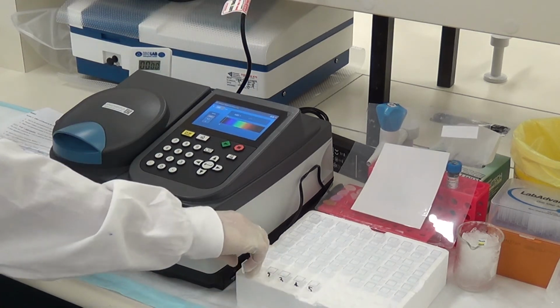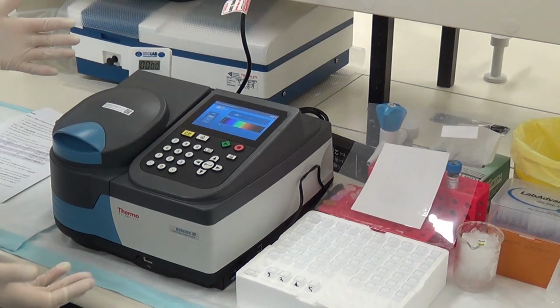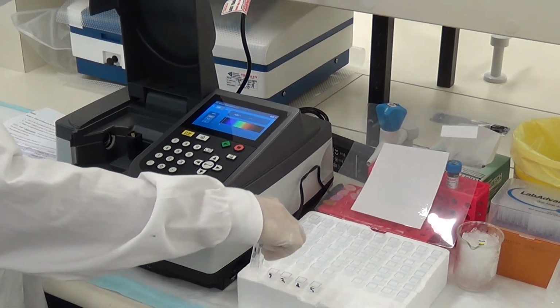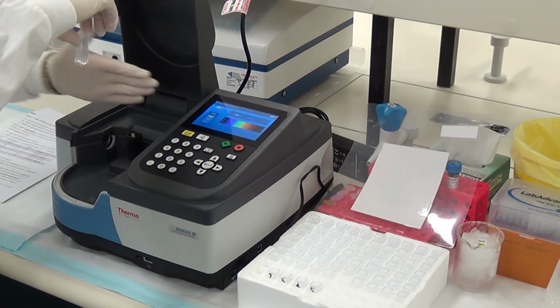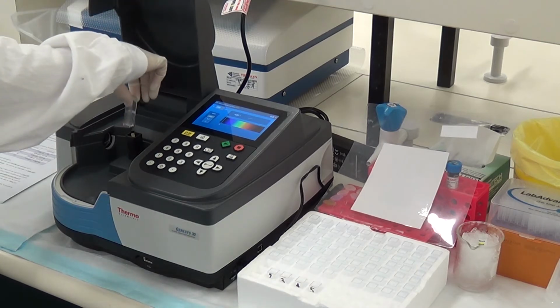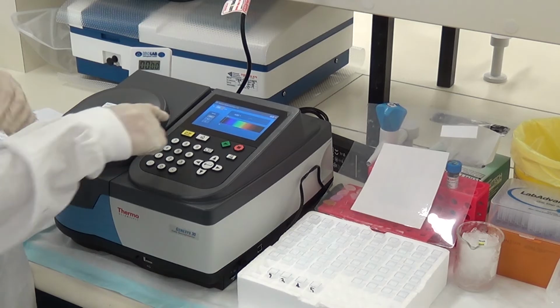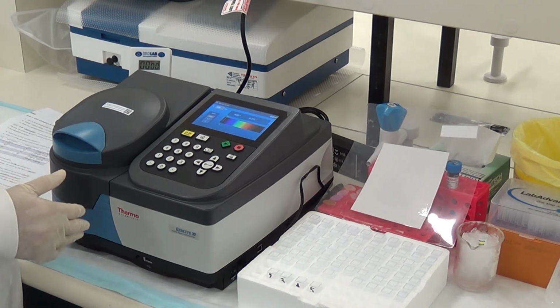So C says blank the spectrophotometer to 0 using an empty cuvette. So we can use several things for blanks, but for this case we're going to use just air, just an empty cuvette. So I open up the spec. I'm going to take the first one that we've got. It's got nothing in it. Make sure the light source is going left to right so I know which side my clear side is. Place it into the spectrophotometer, close the lid and press the yellow 0.00. Our spec machine is now blank, it gives us our baseline and we're ready to start.